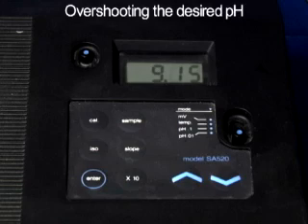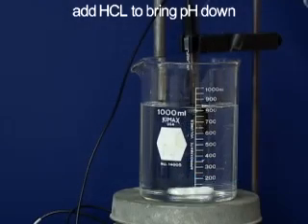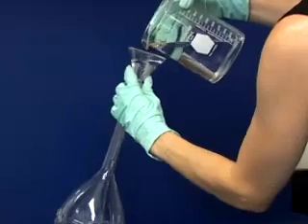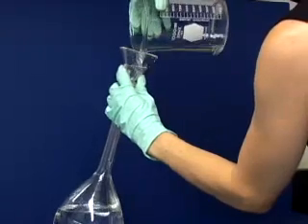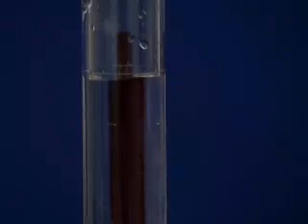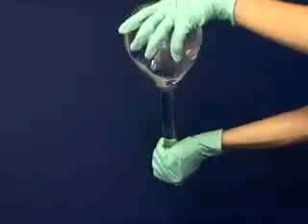If you do happen to exceed the desired pH, then add a hydrochloric acid solution to bring the pH back down. Transfer this solution to a 1 liter volumetric flask, wash the beaker with distilled water several times, and add these washings to the volumetric flask. Dilute the buffer to the mark on the volumetric flask, and mix the solution by inverting the flask several times.